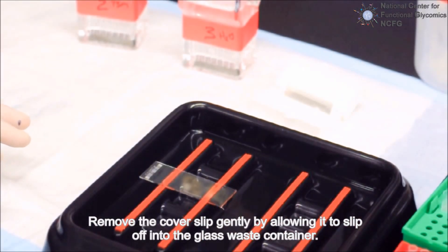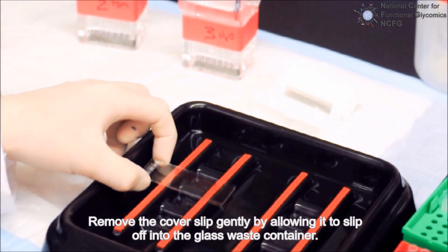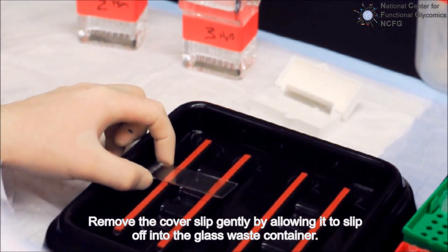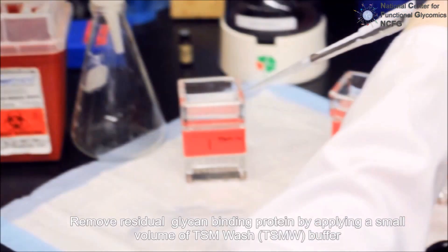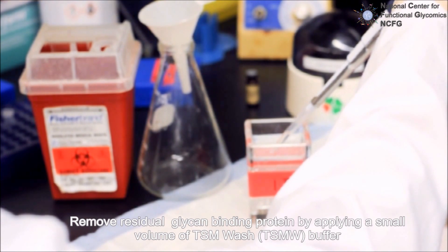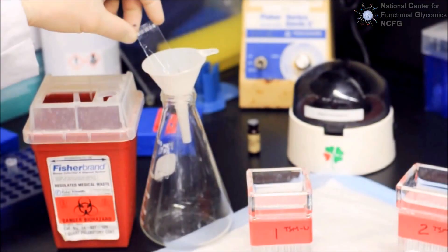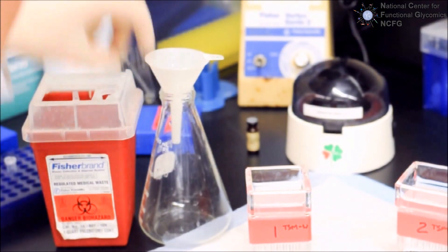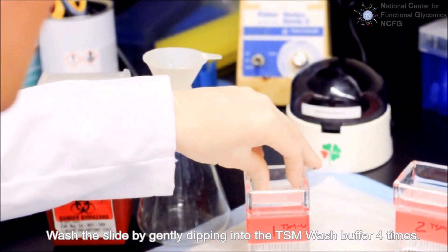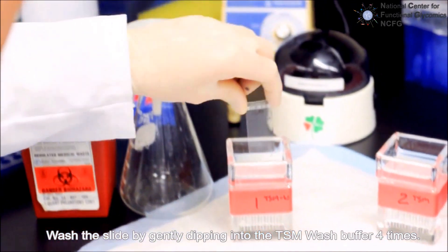Remove the covered slide from the tray and let the cover slip slip off into a glass waste container. Immediately remove residual glycan binding protein with a small volume of TSM wash buffer. Wash the slide by dipping into TSM wash buffer four times.